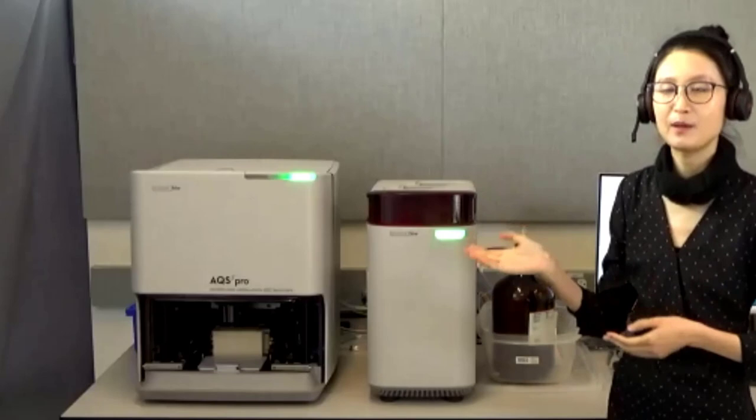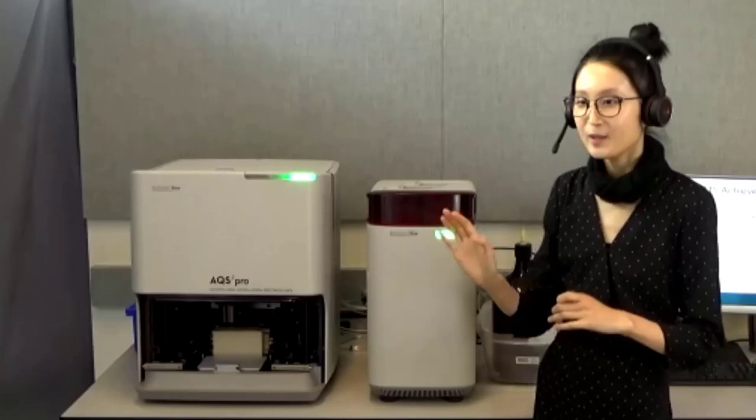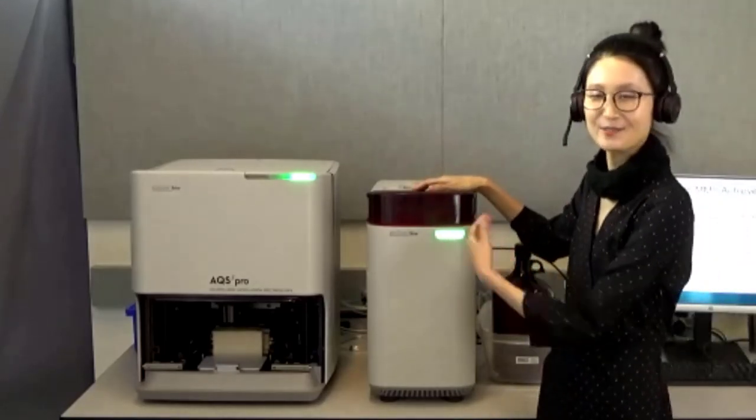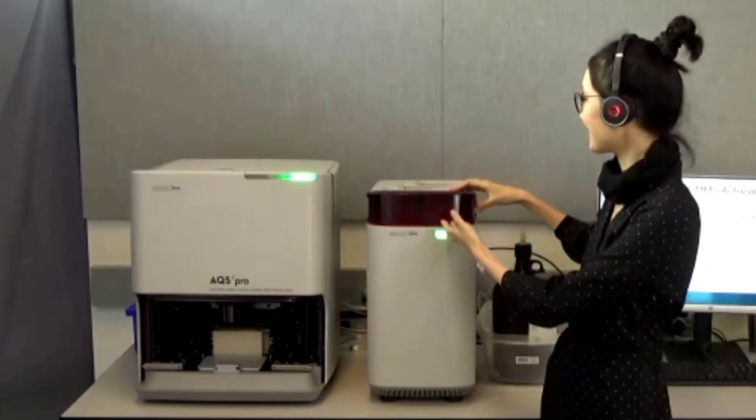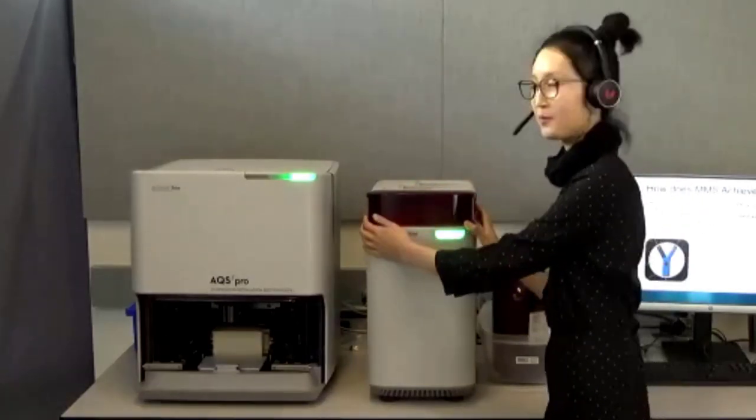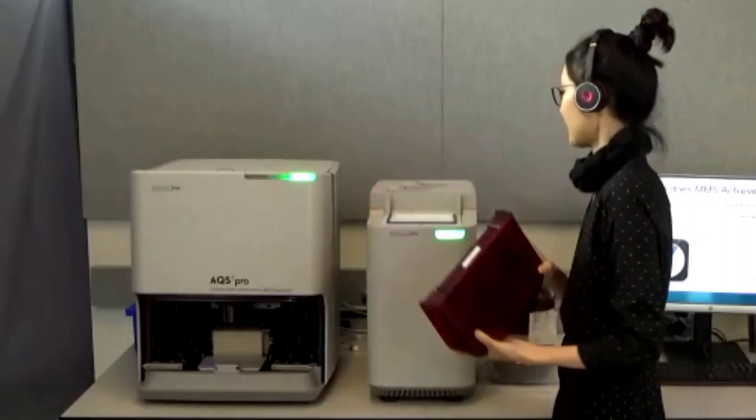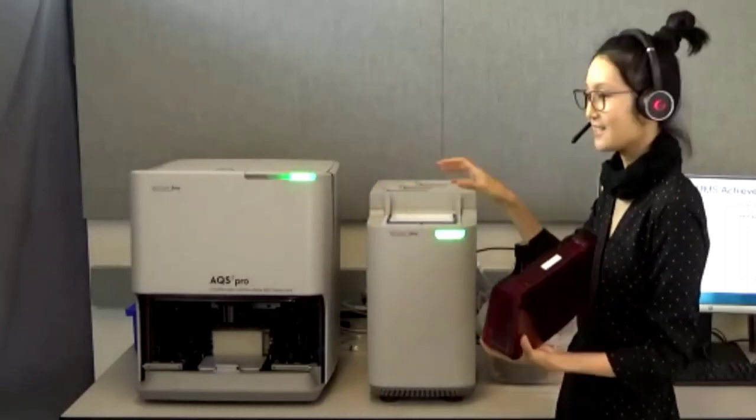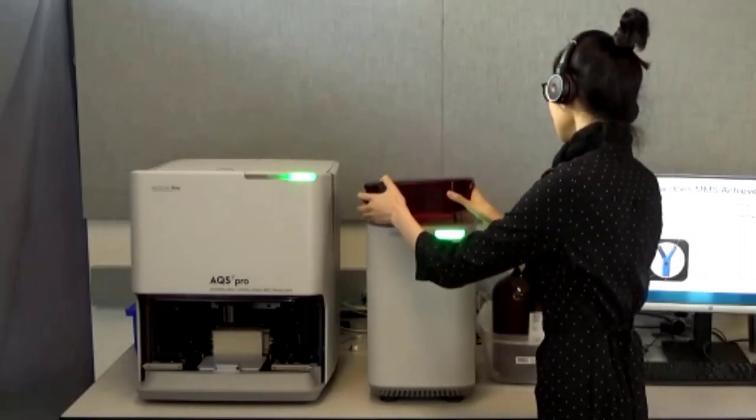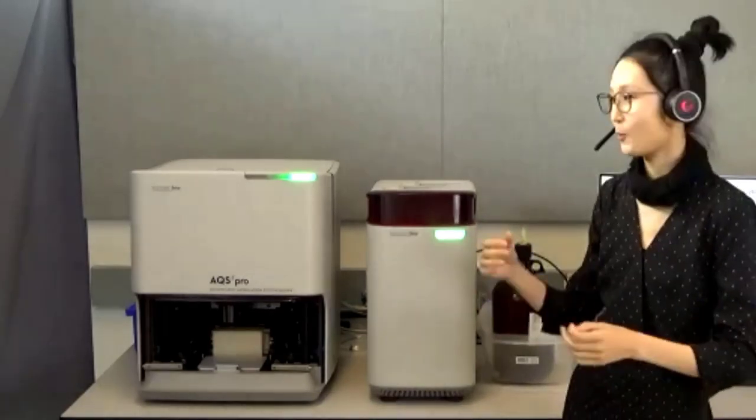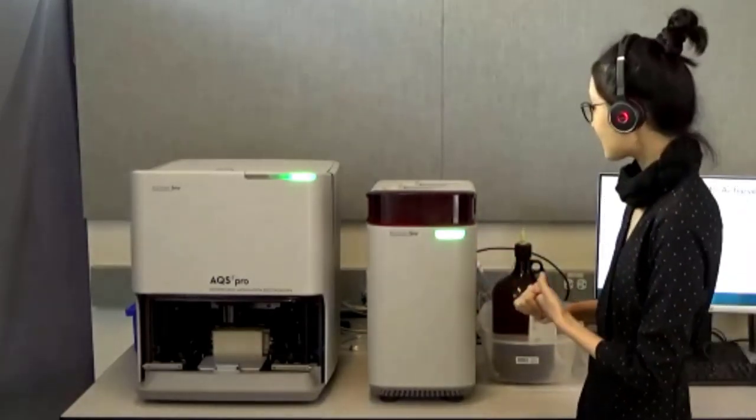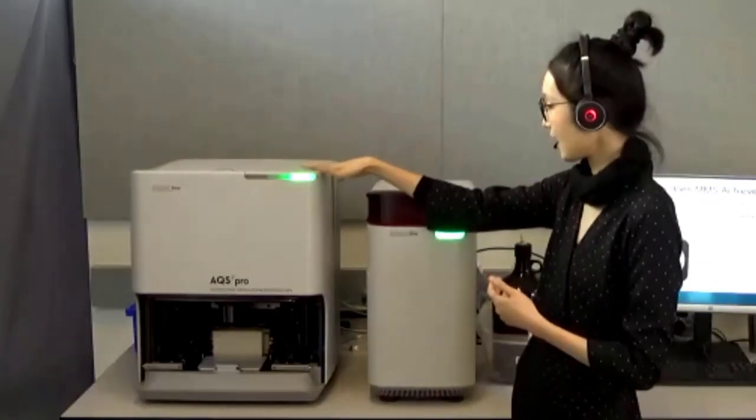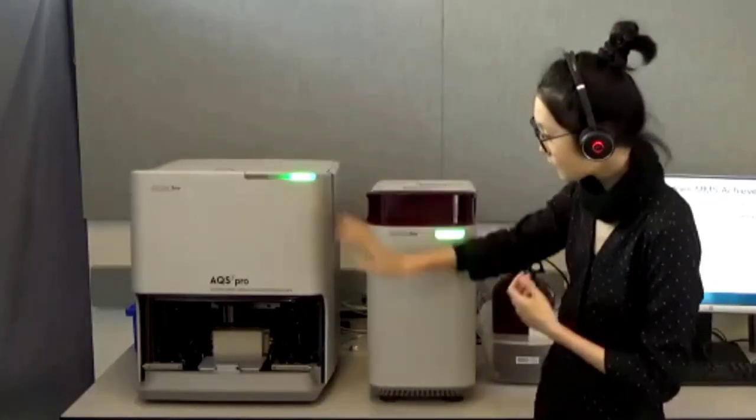The vacuum pump offers a really convenient way for you to degas the sample. You may not notice, you felt like this is a decoration, which is what I thought when I first saw it, but it's actually a secret chamber. If you lift the lid here, it allows you to put your plates inside and then you can close it up and enable the degassing procedure inside the software.